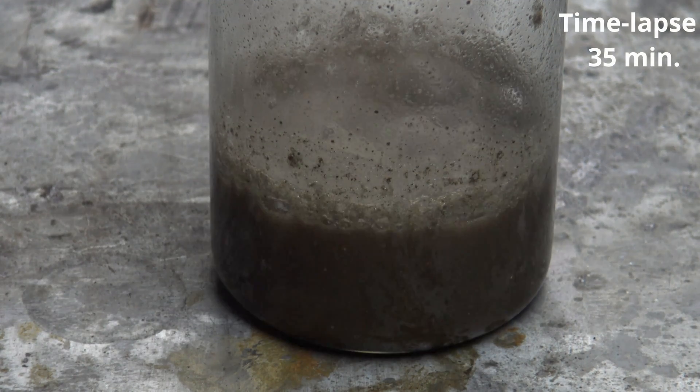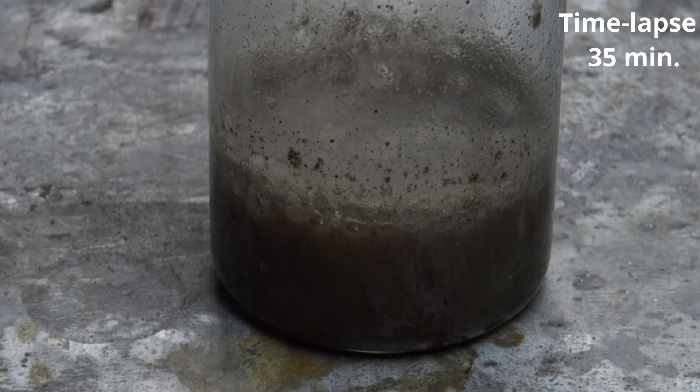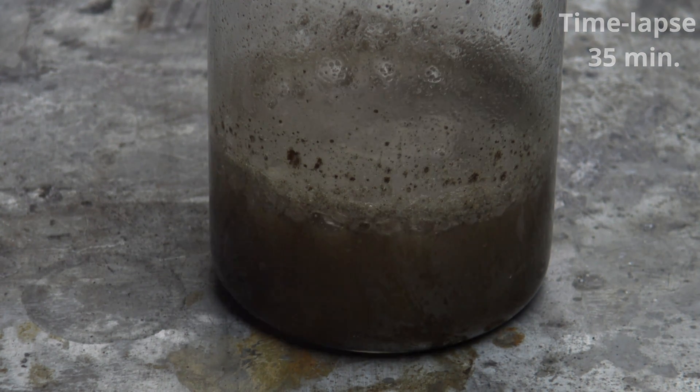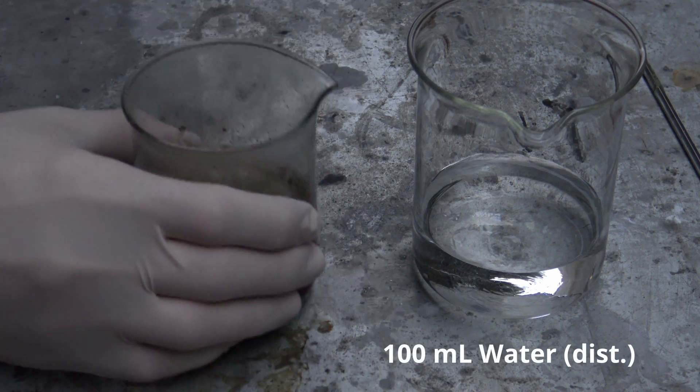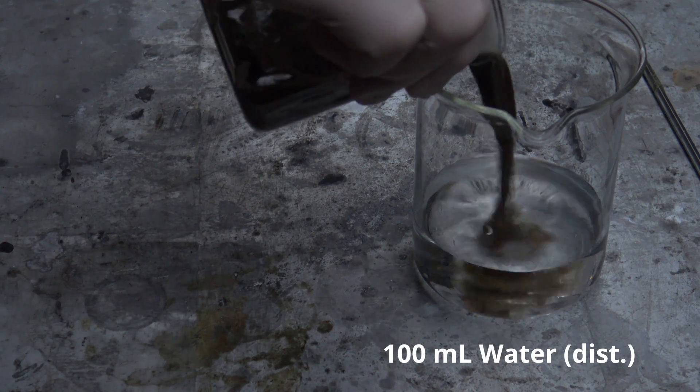In the reaction, the color of the mixture very slowly changes to a brown-green color. To dilute the acid, the mixture was added to 100 ml of distilled water.